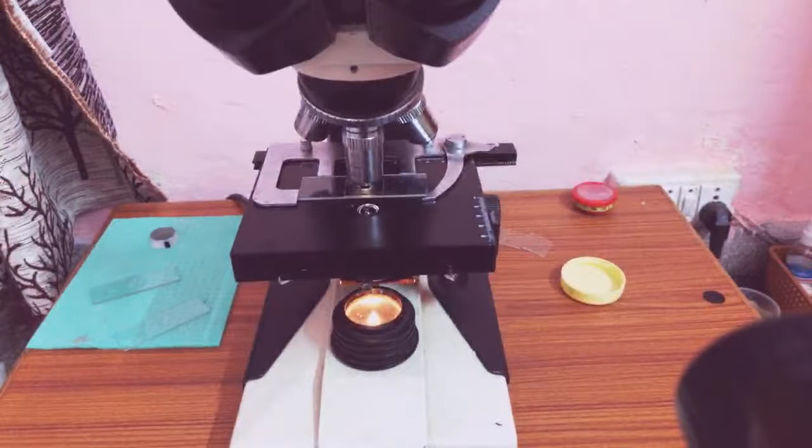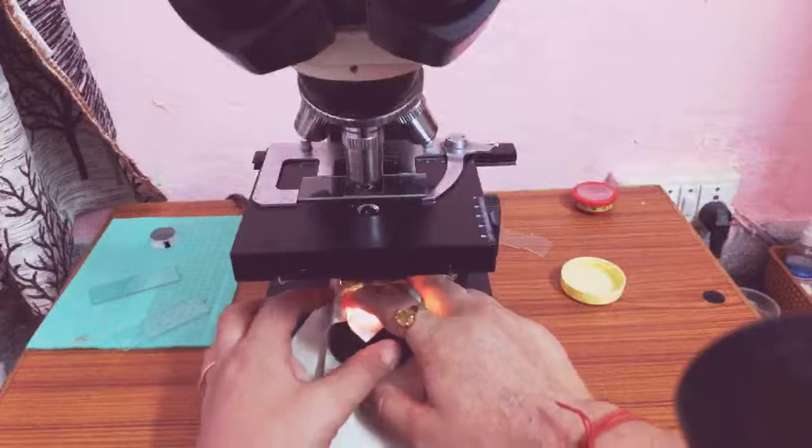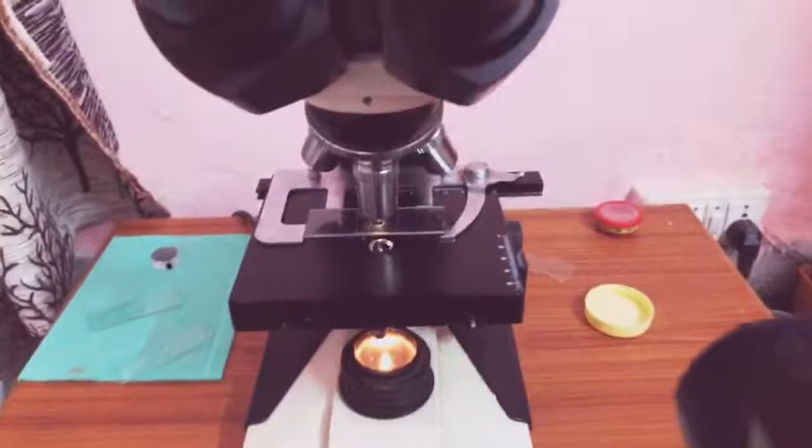No, sir, I've just cleaned the lens, and with all the possibilities, I'm again trying. There was a bubble or some creature, the water shook. Or probably the camera is unable to focus. The problem is, how do I, no, these things don't work. Okay, so let me rechange the arrangement once. Changing the lens will be difficult. Fix it again.